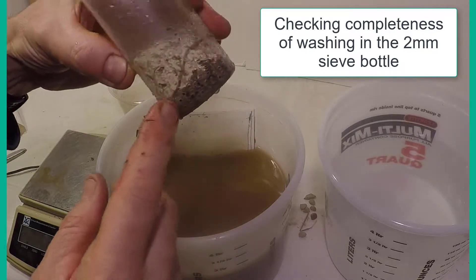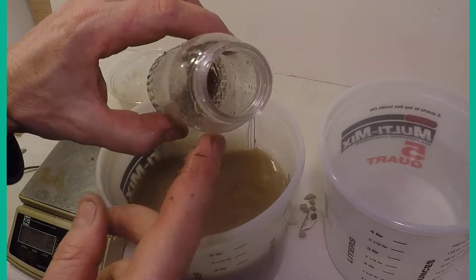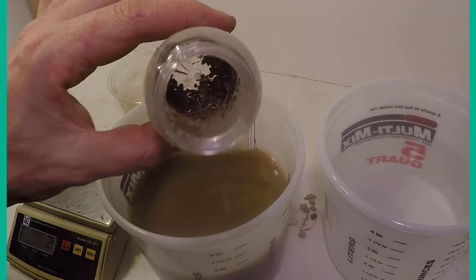You should check the completeness of the washing by examining the contents of the sieve bottle, as shown here.